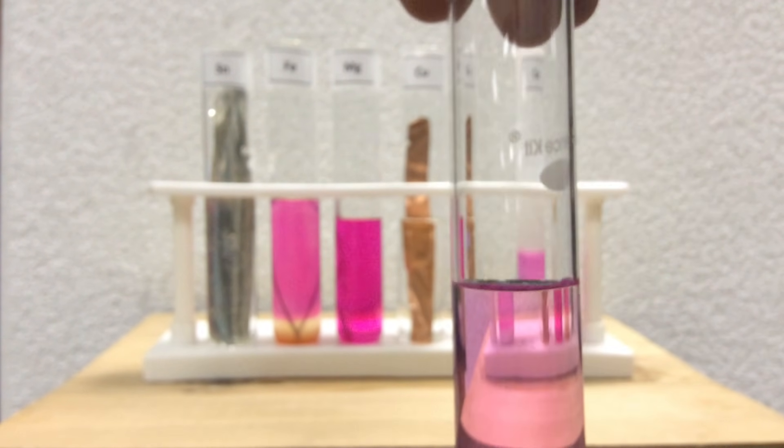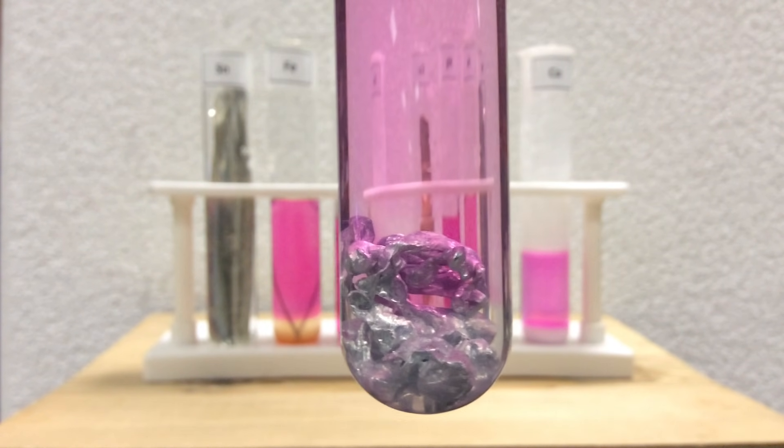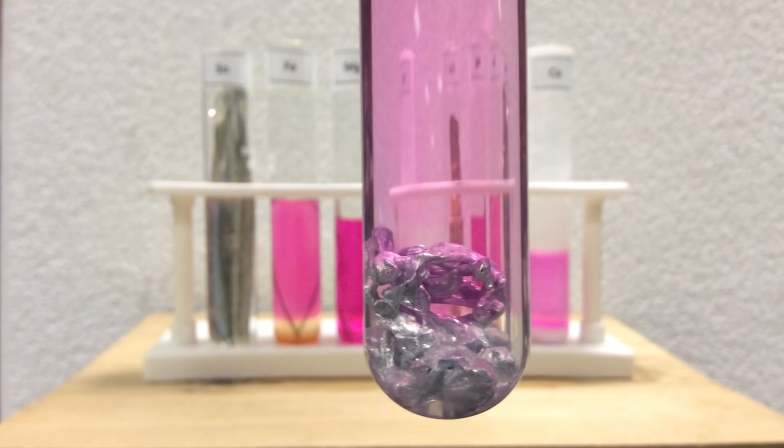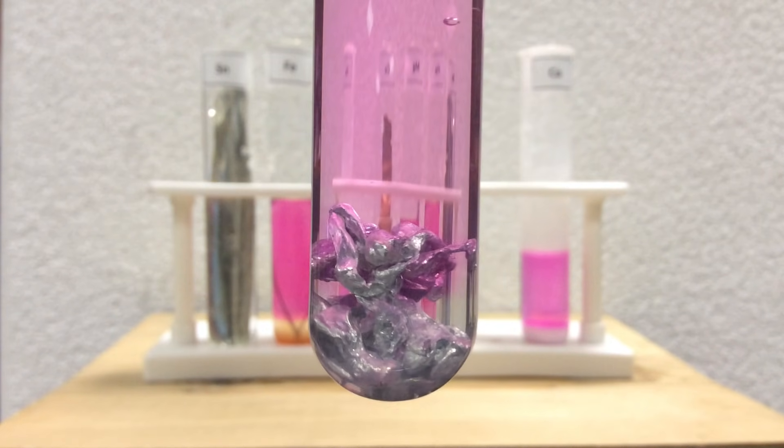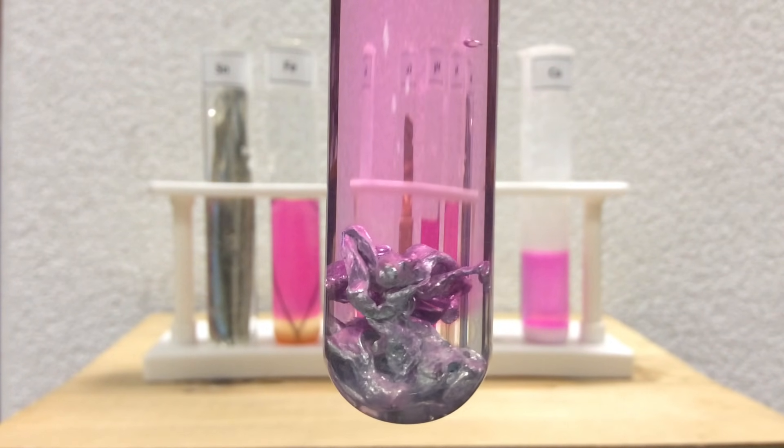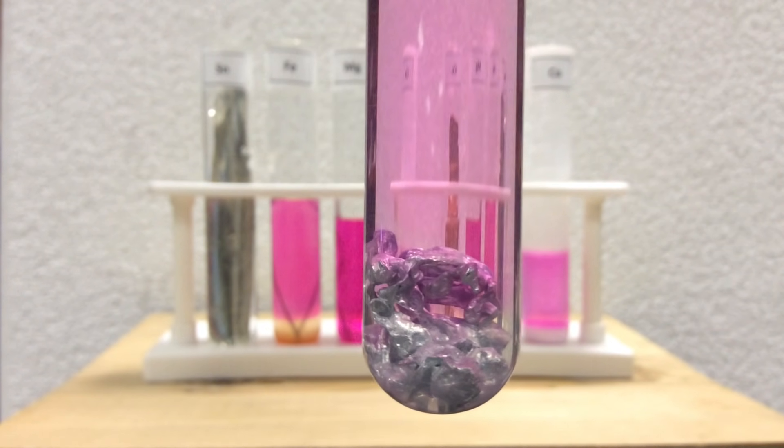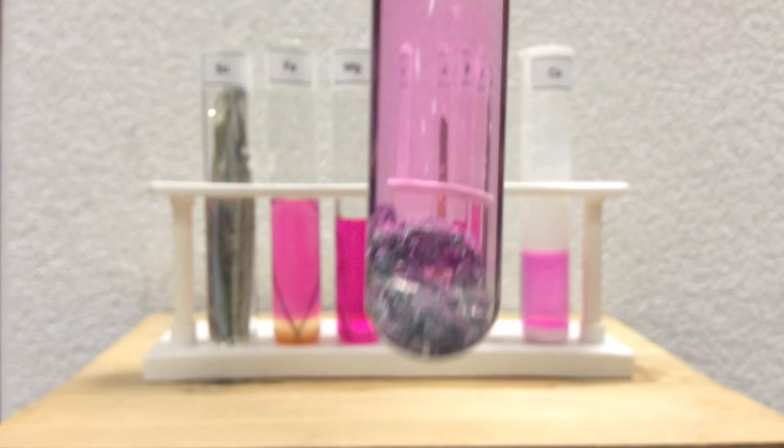In any case, the zinc, which was very reactive in the acid, definitely has some reactivity in the water now. We didn't see that in the previous day, but a day later, you can definitely see the presence of zinc hydroxide or the phenolphthalein, who's indicating a base was made.